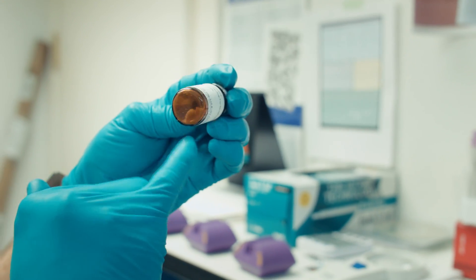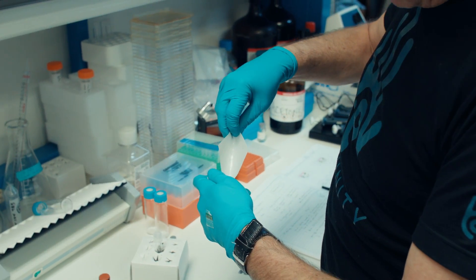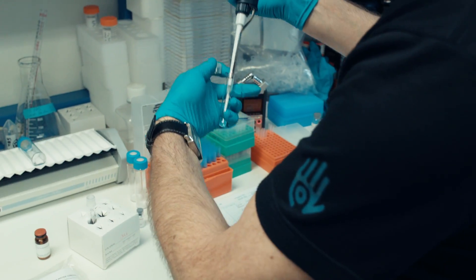This is the HLA-B27 peptide in powder form. I'm going to weigh it out, solubilize it, and this is going to go into our next cocktail.